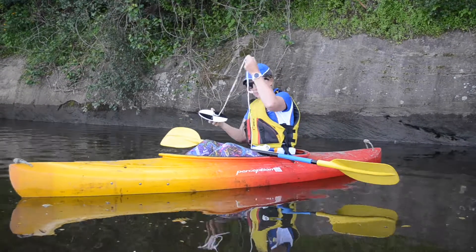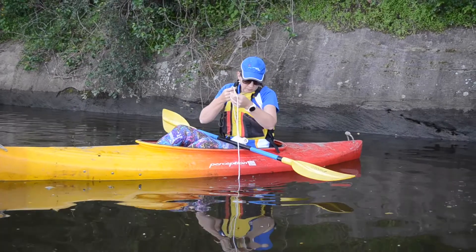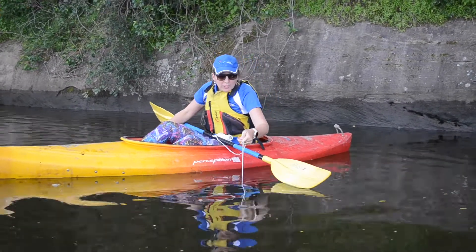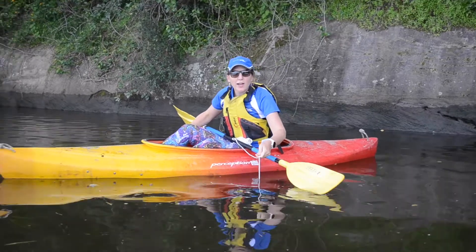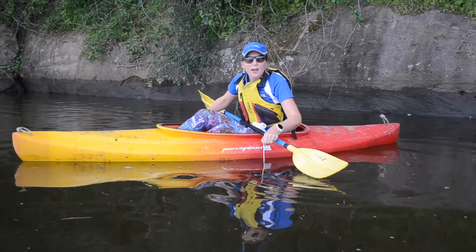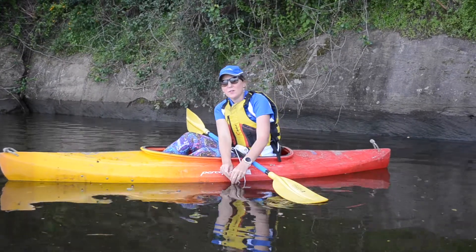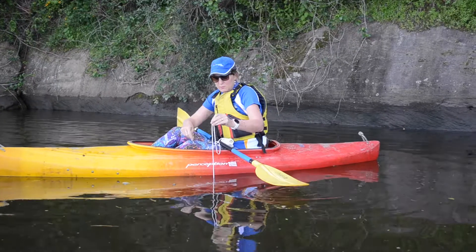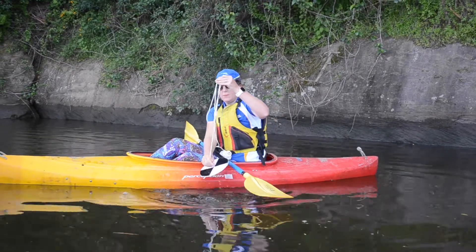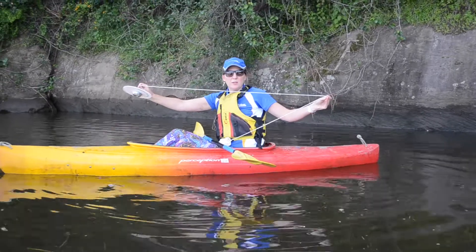So here goes. Obviously we don't want to lean too far over the side of our kayaks, otherwise we might fall in — like I almost did then. And that's as far as I can go. I'm going to pull that out now. We're going to measure that distance and that will help us to work out our turbidity.